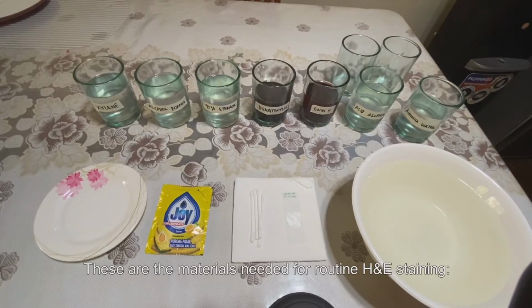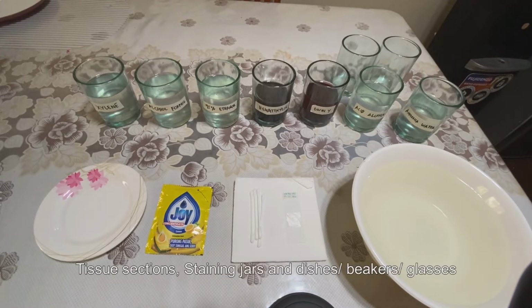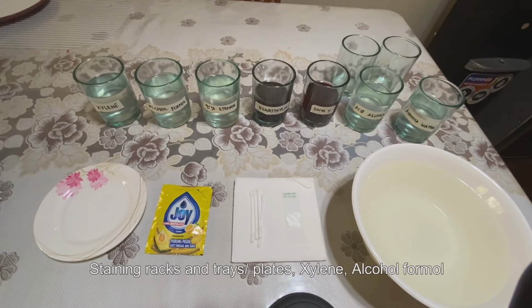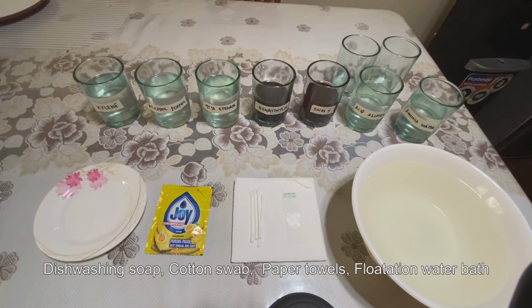These are the materials needed for routine H&E staining: tissue sections, staining jars and dishes, beakers or glasses, staining racks and trays or plates, xylene, alcohol formol, 95% ethanol, hematoxylin, eosin Y, acid alcohol, ammonia water, dishwashing soap, cotton swab, paper towels, and flotation water bath.